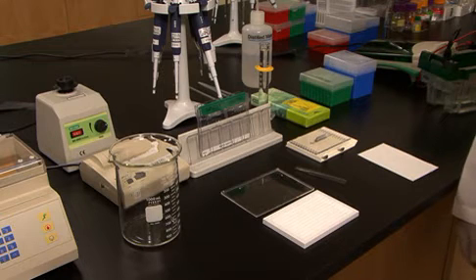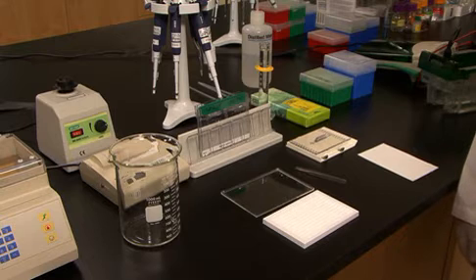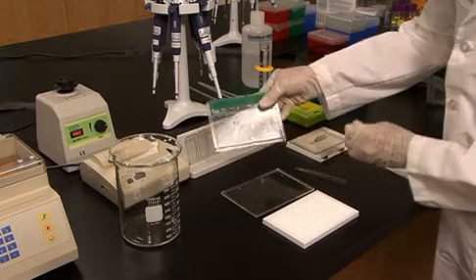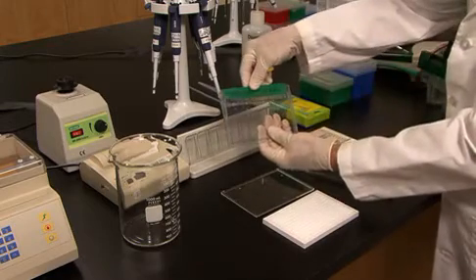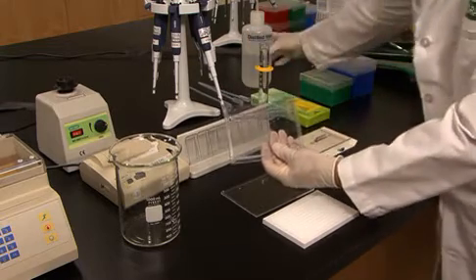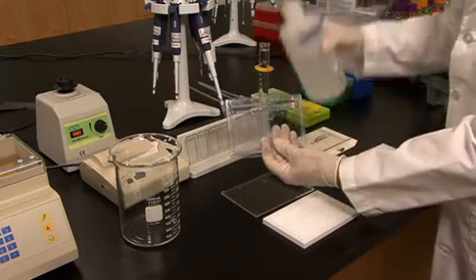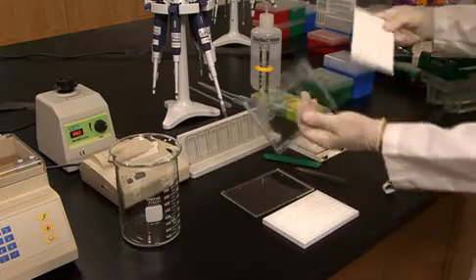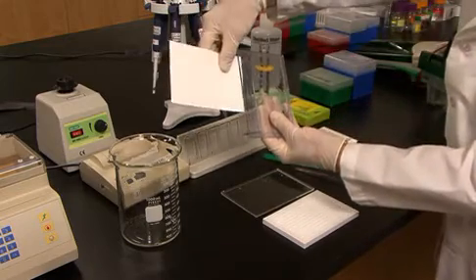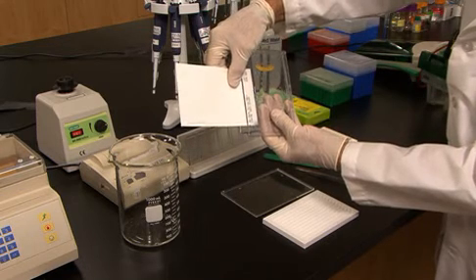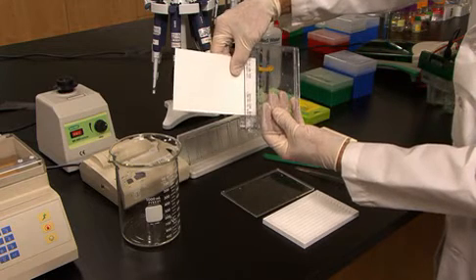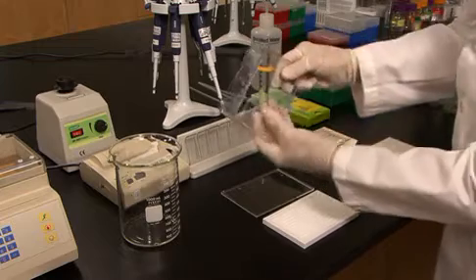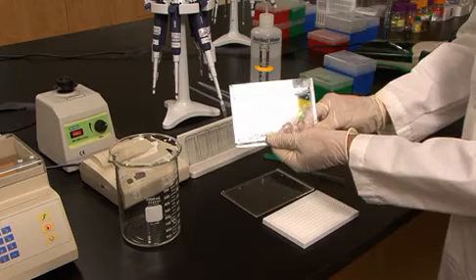I am going to use Bio-Rad's Criterion precast gels which accommodate the 11 centimeter IPG strips that we ran earlier. Prepare the gel by removing the sealing tape from the bottom of the gel and slide out the comb from the top. Rinse the wells with good quality DI water, tap the water out into a beaker, and then place the gel sideways and remove with a piece of filter paper the excess water from the wells. We usually do this because unpolymerized acrylamide can cause anomalies in your second dimension gel if it is not removed.